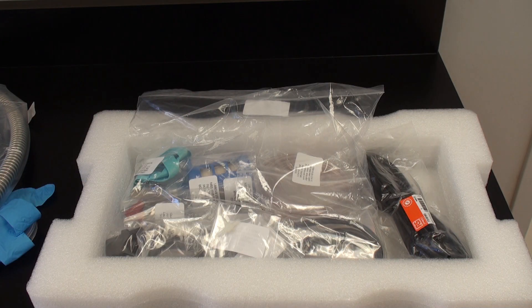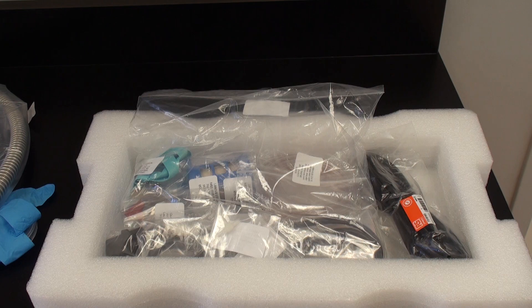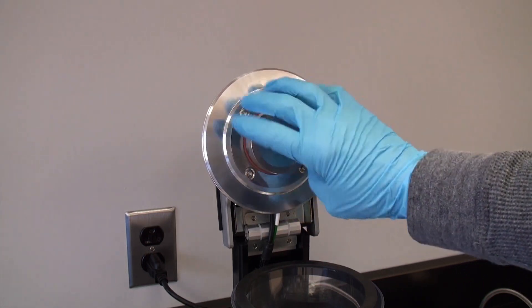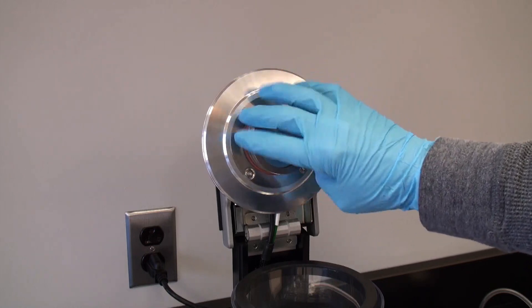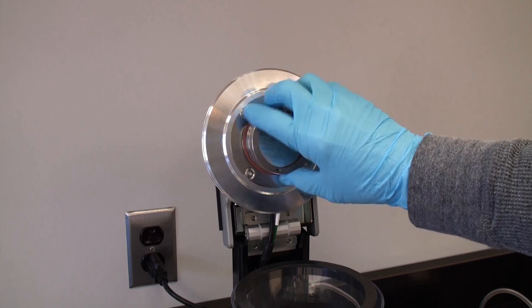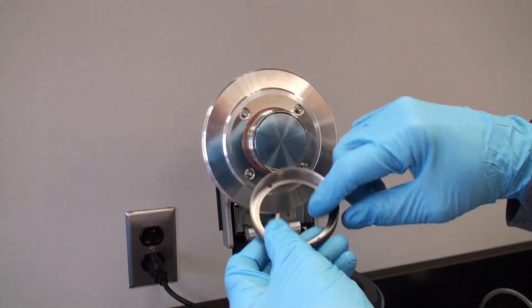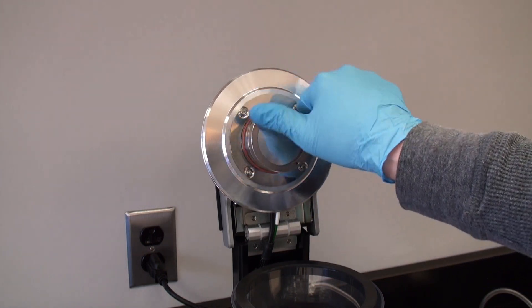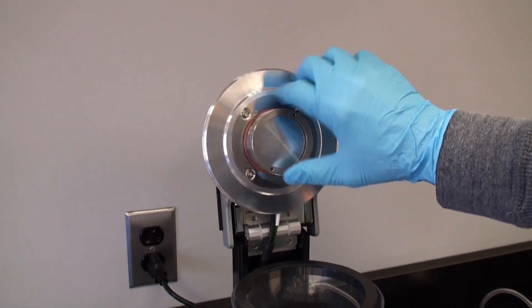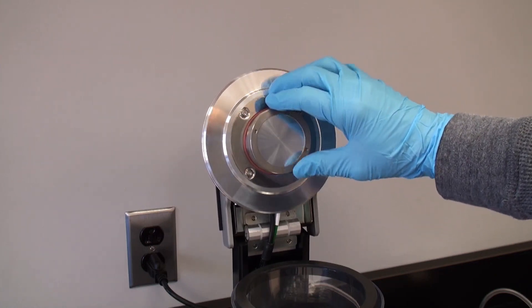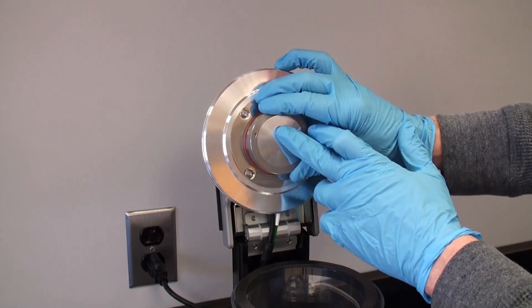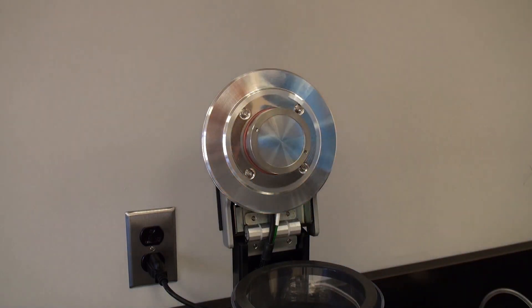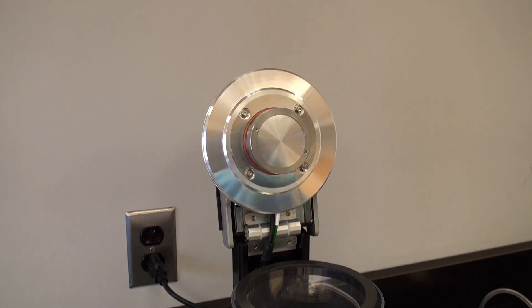Targets are easily installed and changed by unscrewing this threaded collar, then inserting the foil target in this device into the collar. It's called the target retaining ring. And then just tightening it back down, and I usually center the target so the edge of the target shows on either side, and then I just lightly tighten it so it doesn't move around when you raise and lower the sputter head.